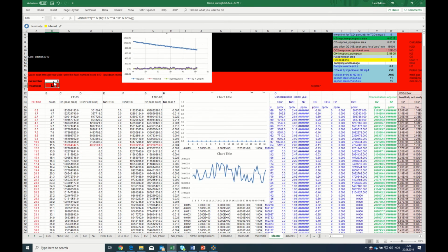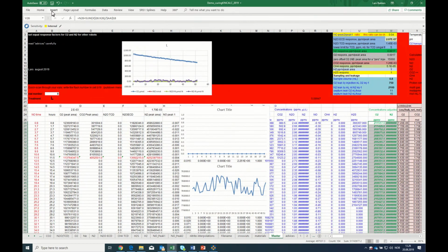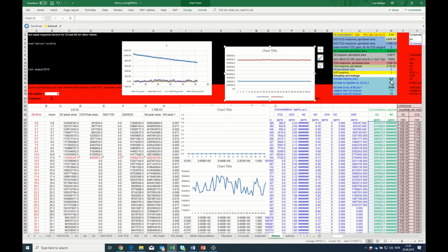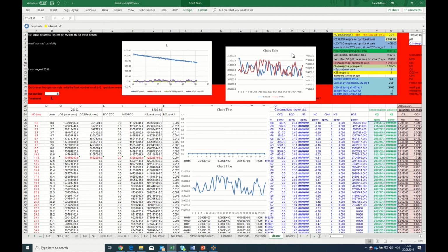if I was a supervisor, I would go to my low standard, that's air. So that contains a lot of oxygen and nitrogen, and I should have essentially flat curves in the two green columns, which I do have. So that means that my volume, my injection volume, has been set right. If I want to inspect them in more detail, I can format and set this to the secondary axis, and we get a different scaling. And you see that the two variables in the air sample is okay.